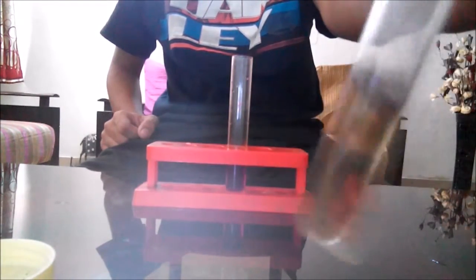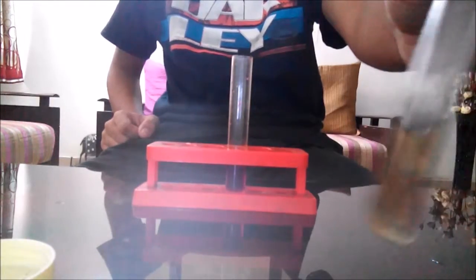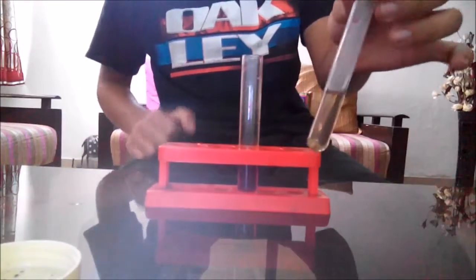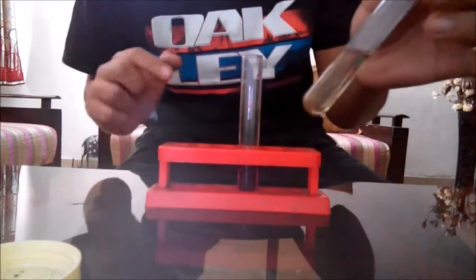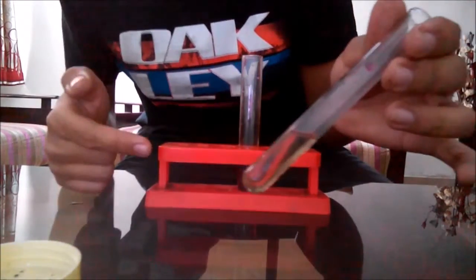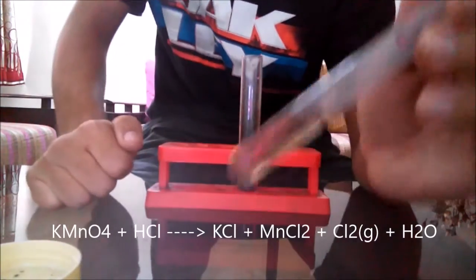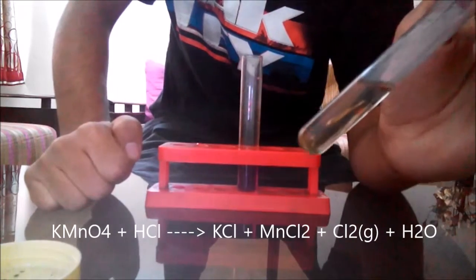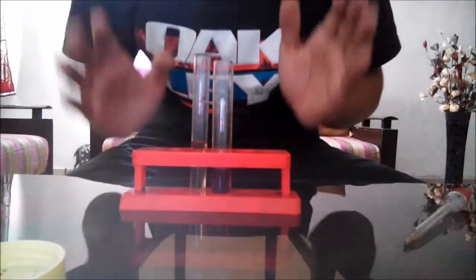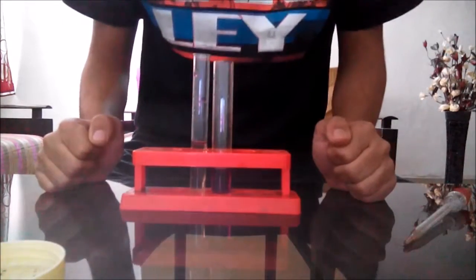Slowly it has turned colorless because chlorine gas has been released. You can see some vapors being condensed on the inner walls of the test tube. This chlorine gas is being released because the strong oxidizing agent potassium permanganate has oxidized the chloride ion in hydrochloric acid to chlorine gas. So here the oxidizing nature of potassium permanganate comes into play in this reaction. In this video we saw the oxidizing nature of potassium permanganate on four different chemicals.